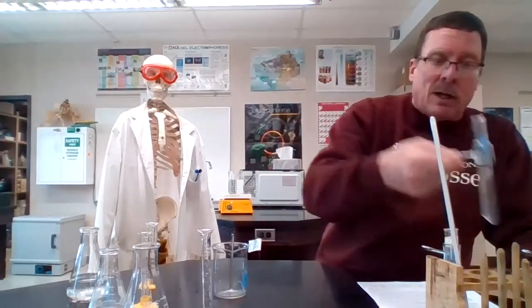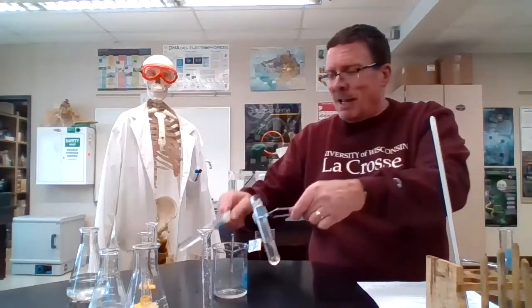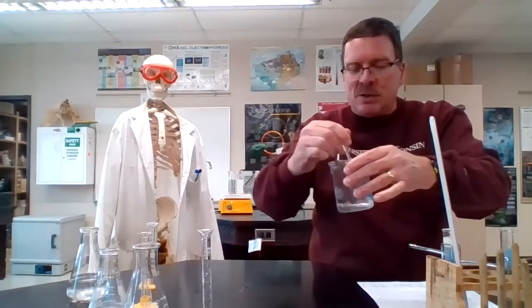Okay, pause time. We'll be back with higher temperatures. Okay, we're back. We're at the 35-degree mark. I want to get things going before they cool down too much. There's my B. There's my A and C. There's my timer. We assume this is going to be faster than 70 seconds.